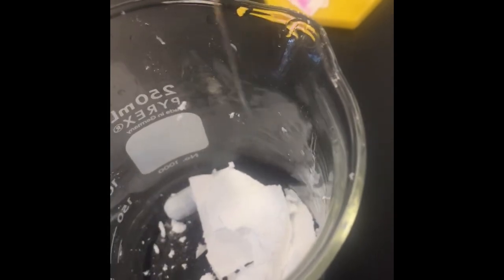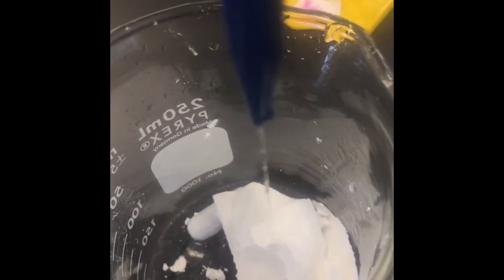So here we have our crude salicylic acid. We are going to add some water to dissolve it, or at least get it wet, and then we are going to heat that up.